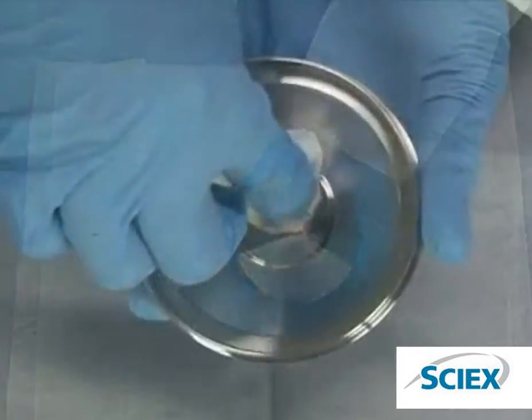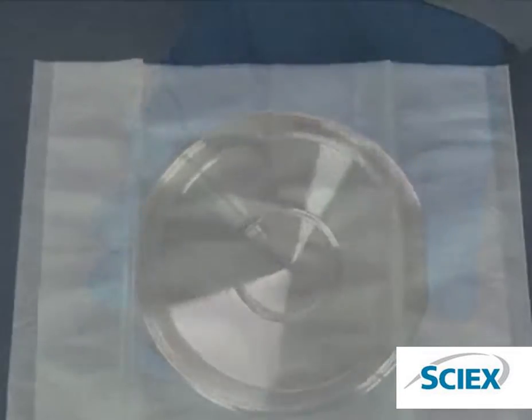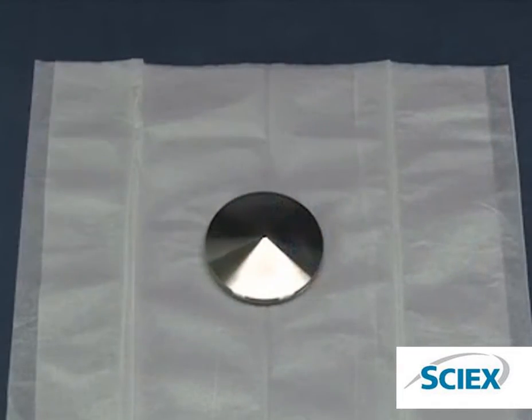Using a dampened wipe, clean the aperture. Place the cone up on a lint-free wipe to dry.